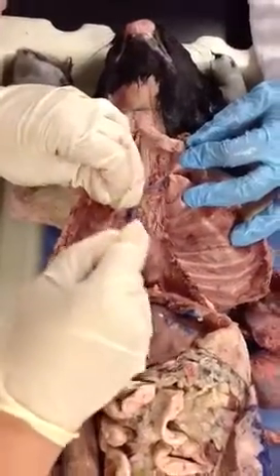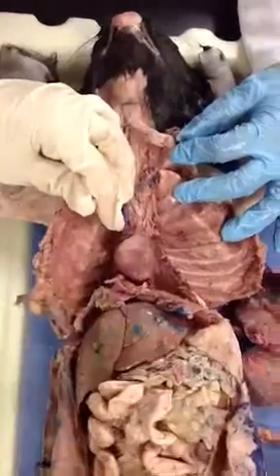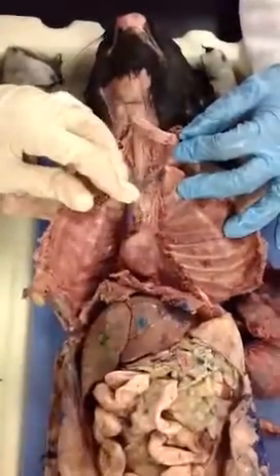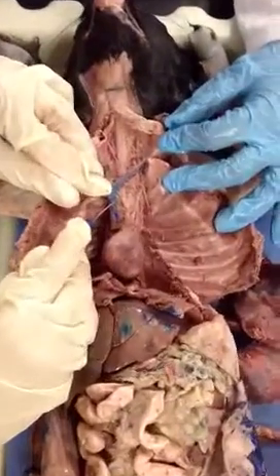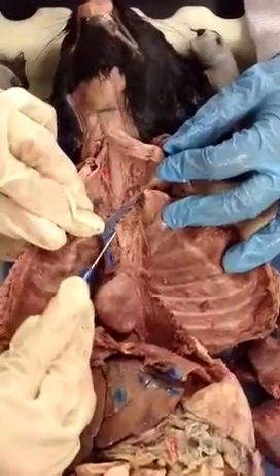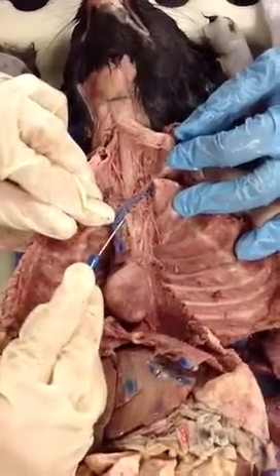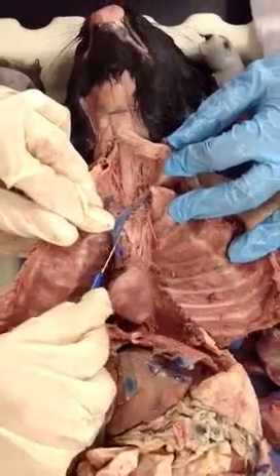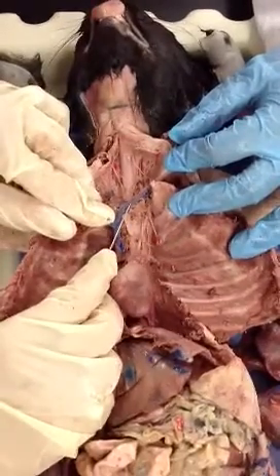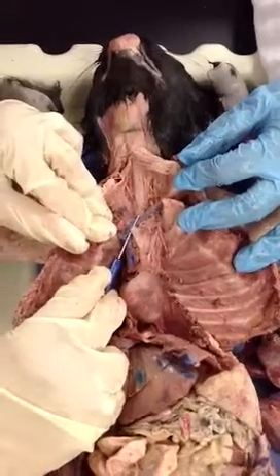All right. You see, just separating with the probe, cleaning it up. Now, immediately you notice that something is tilting to the right side. Do you see it? These are going straight, but this one is tilting to the right. Yes? So then this, immediately by anatomy, I know it's going to be my right subclavian. You see how it's going towards the right?